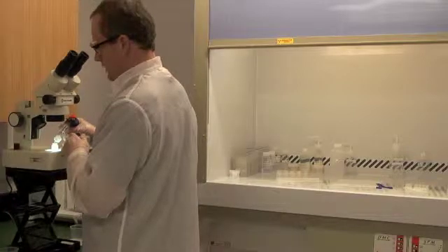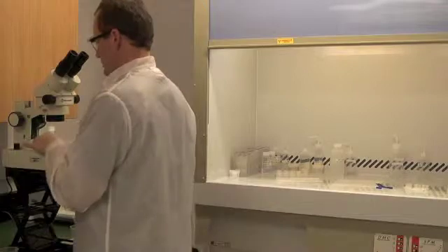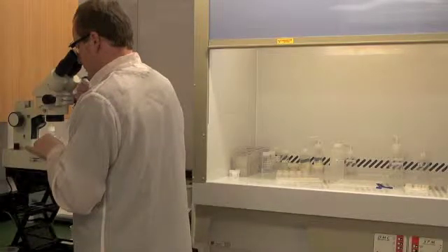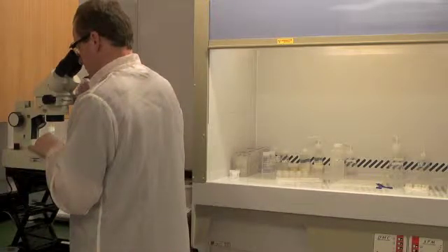I'm now going to add fresh nitric acid. Again, pick up the grain and discard that liquid. Place the grain back in the beaker.